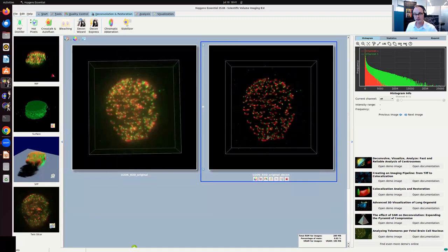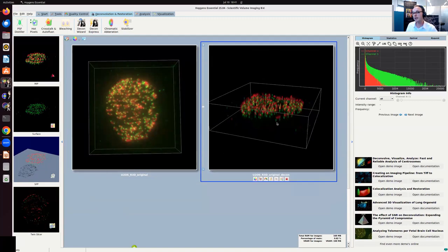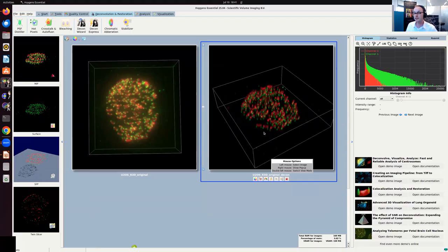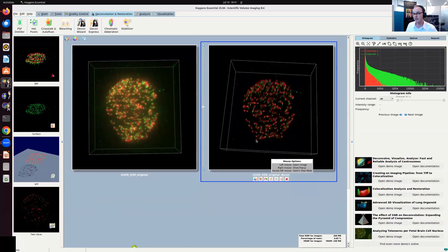So here it is. Now it has been deconvolved, but not yet corrected for chromatic aberration. So let's do that next. And I'm going to do that in this menu. I can also find the hot pixel corrector, the crosstalk corrector, the bleaching corrector here. And for the chromatic aberration corrector, I'm going to use the window. The wizard has similar functionality, but goes through it step by step. And the window just gives me all the information in one view.